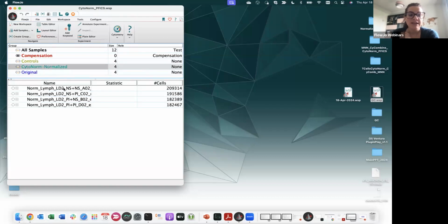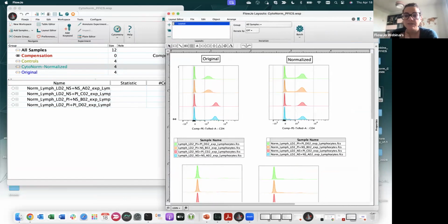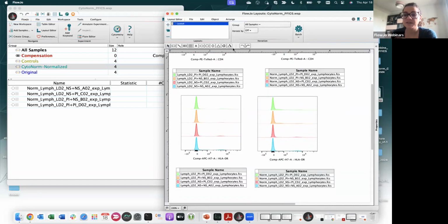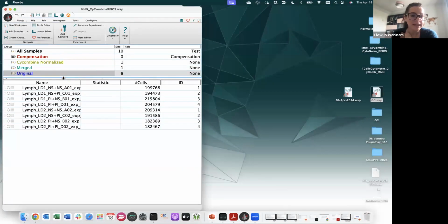So when I have my normalized files, now these are basically my original, as you see, LD2. My original was LD2. And I have the normalized files right here. You can compare what happened during or after the normalization. I just made this for you guys. And you can see, for example, for CD4, these are my original files and these are my normalized files. So I basically aligned the intensity for CD4 for all the different batches, okay? But now this can be tricky if you have small biological differences that you want to see. And you may lose these differences when you normalize because you are basically aligning everything, while for other markers, nothing happened, basically, okay? While for cycombine and MNN, okay, let's show you first cycombine.